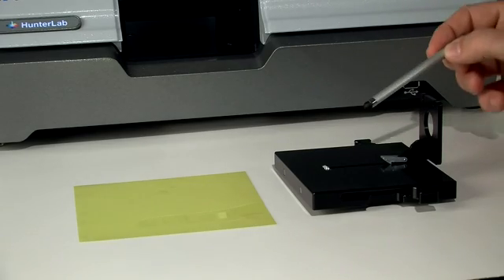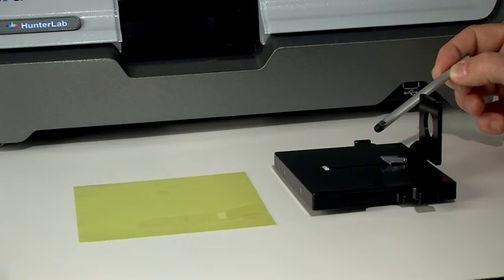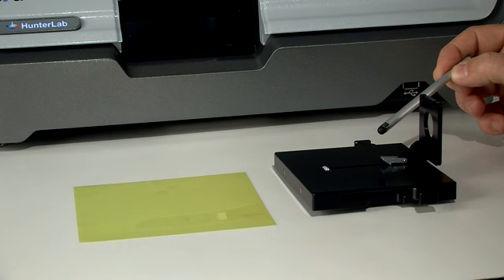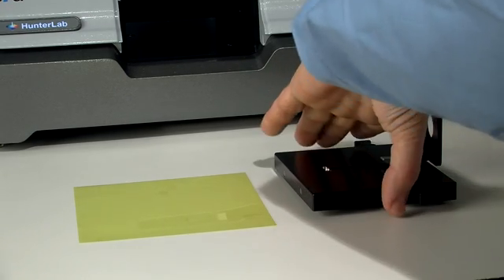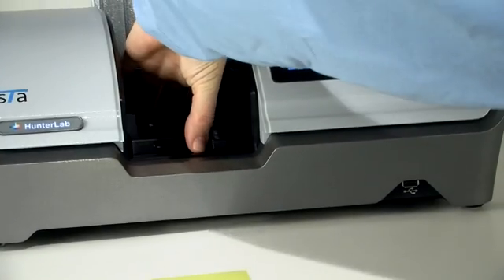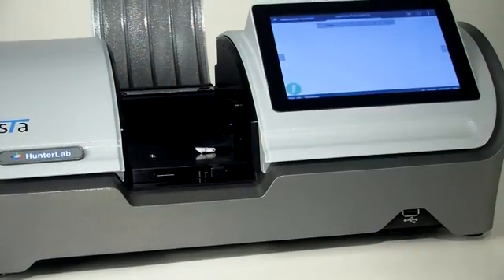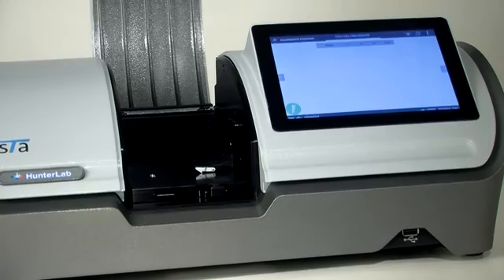We will use the spring-loaded film and cell holder base plate for this demonstration. Place the base plate in the transmission compartment. The base plate will self-align and be held in place by magnets.